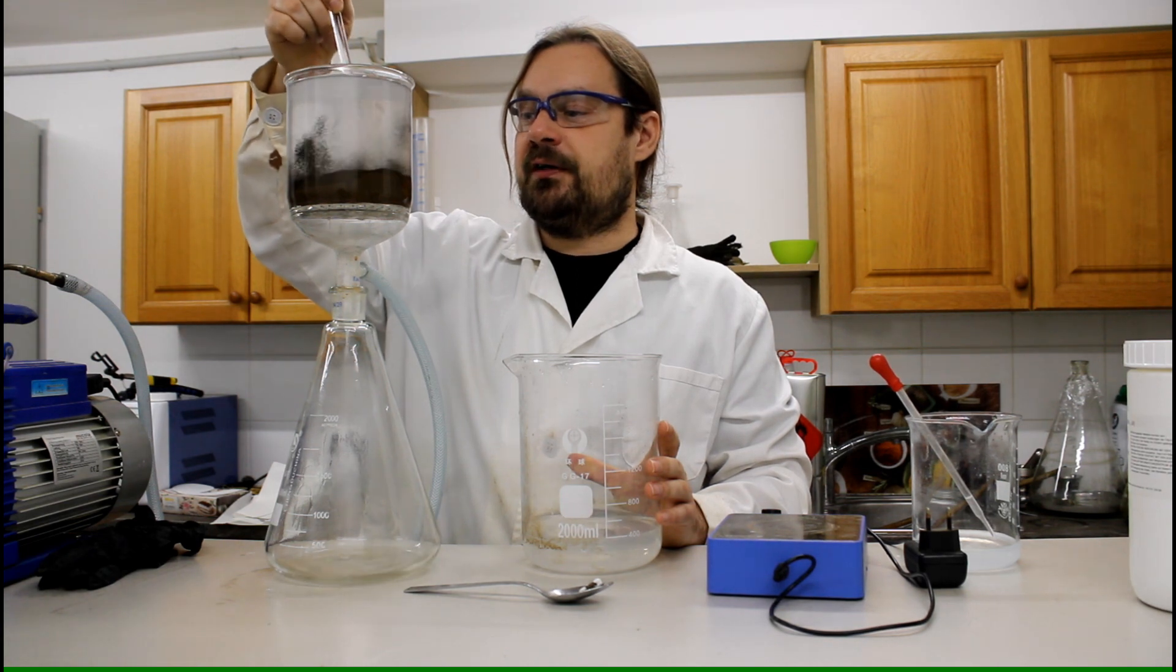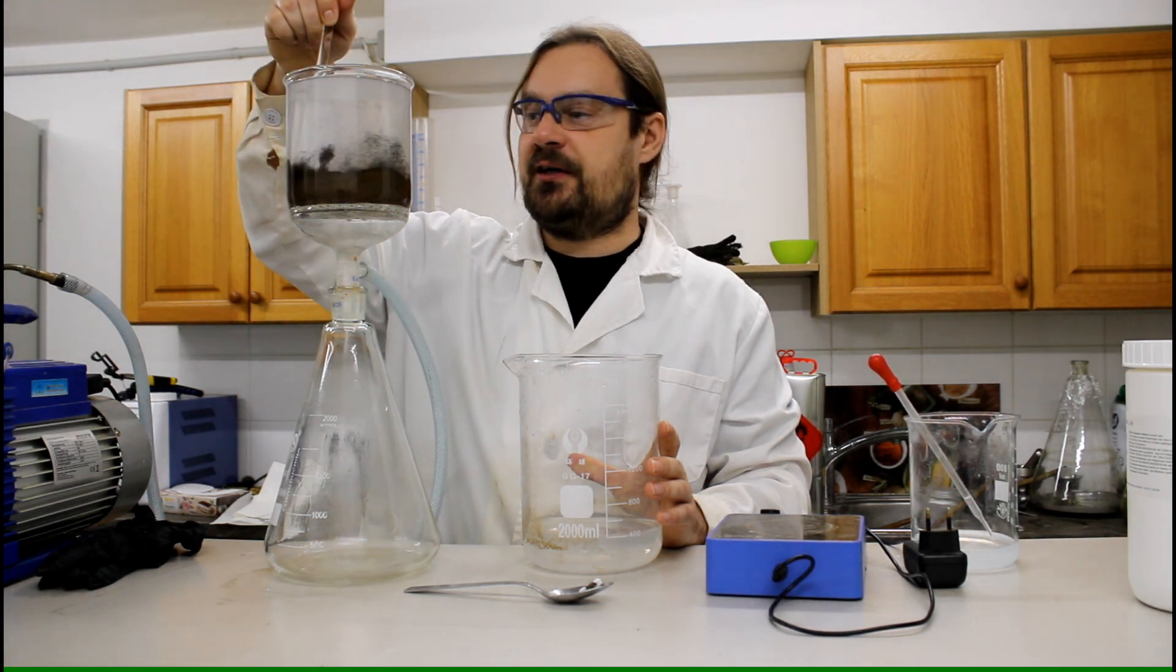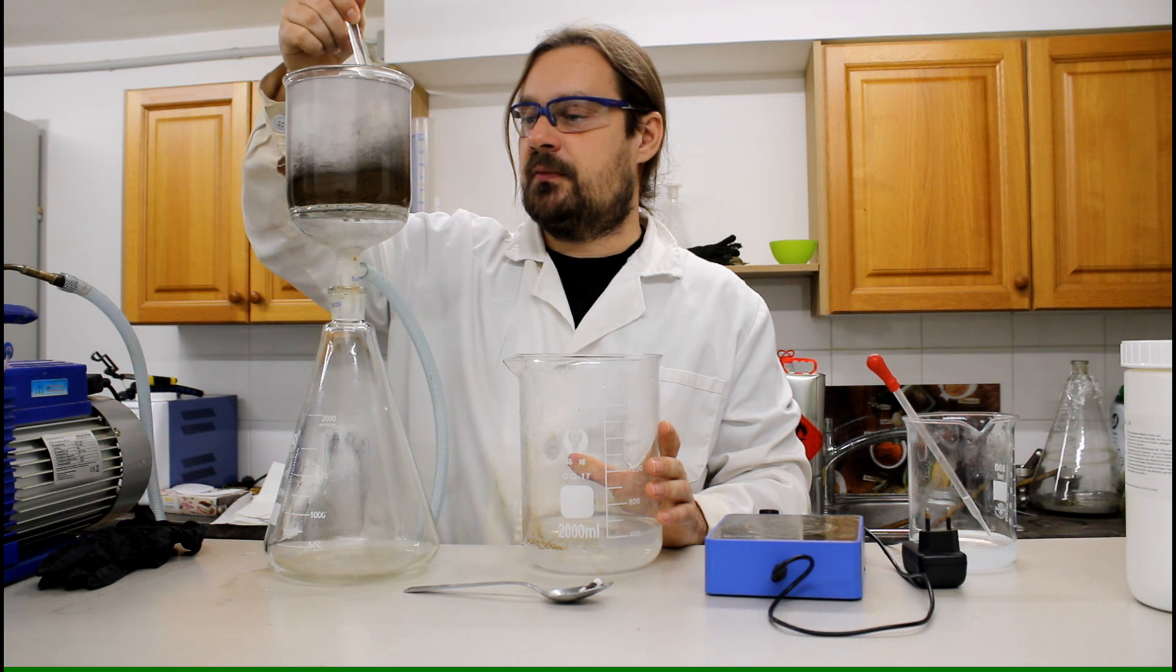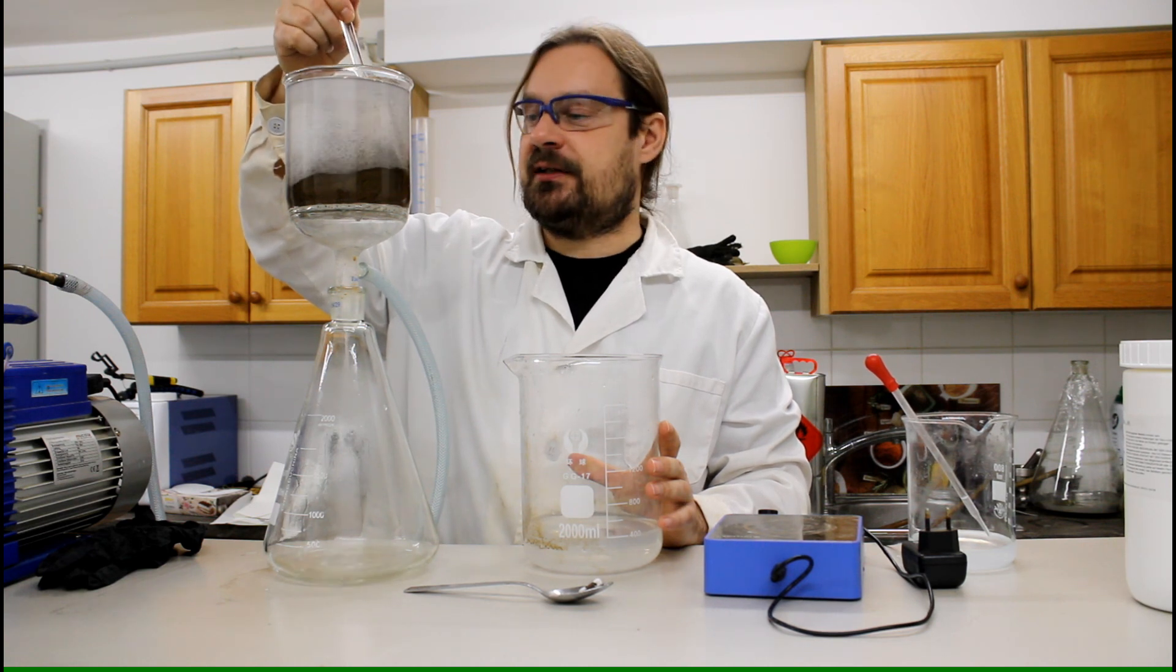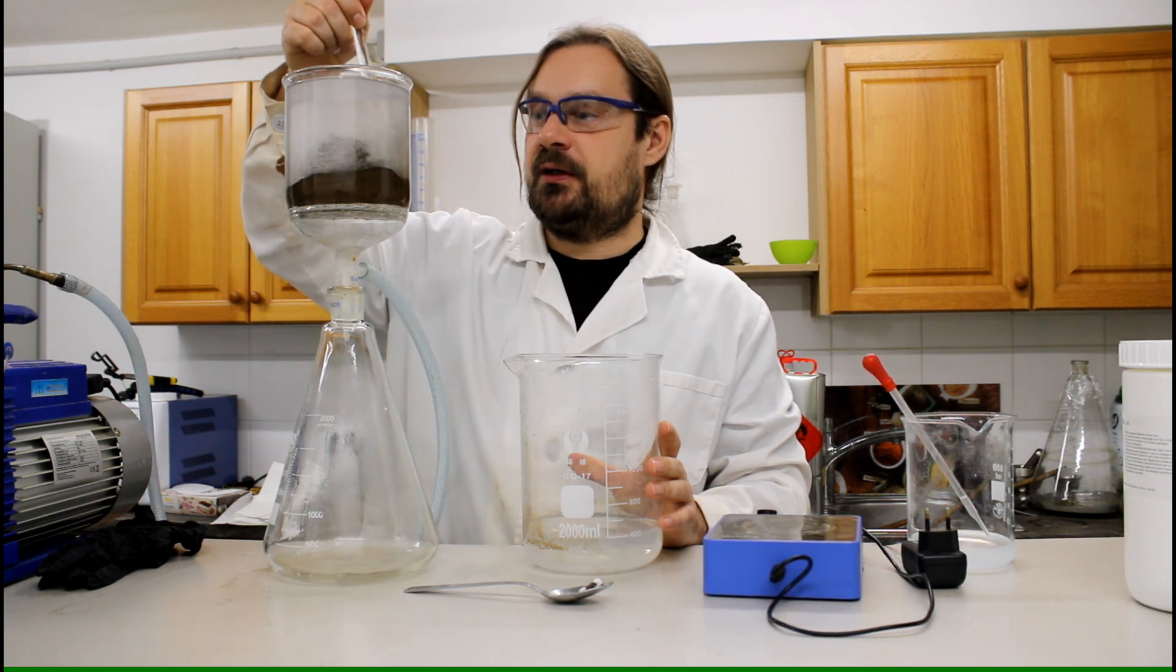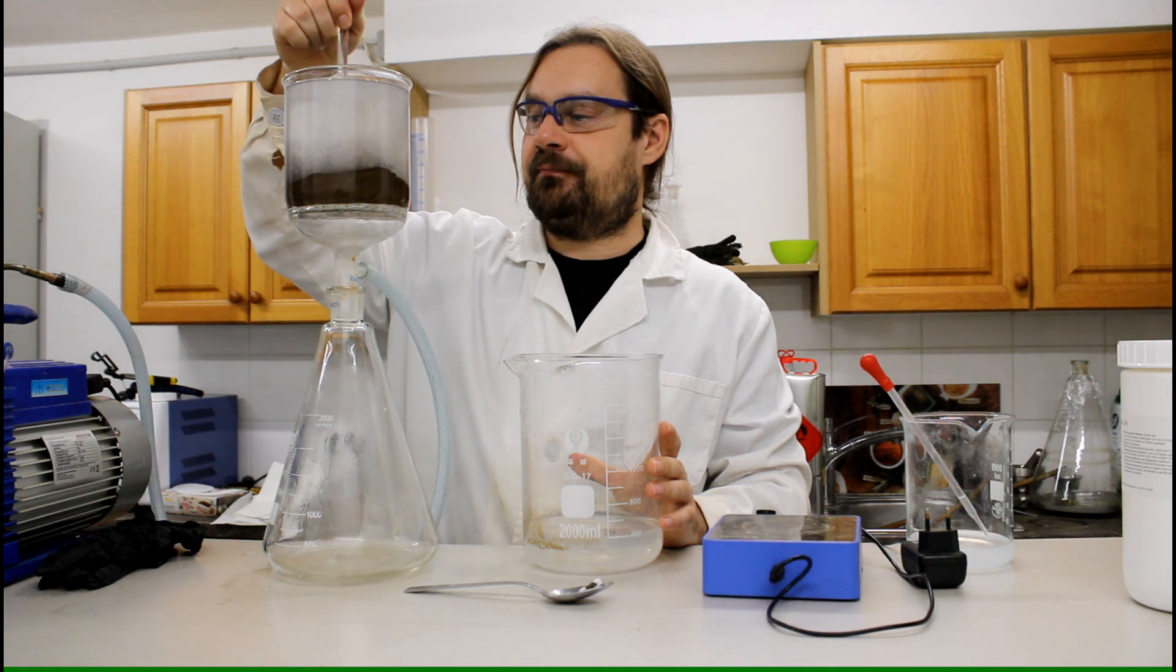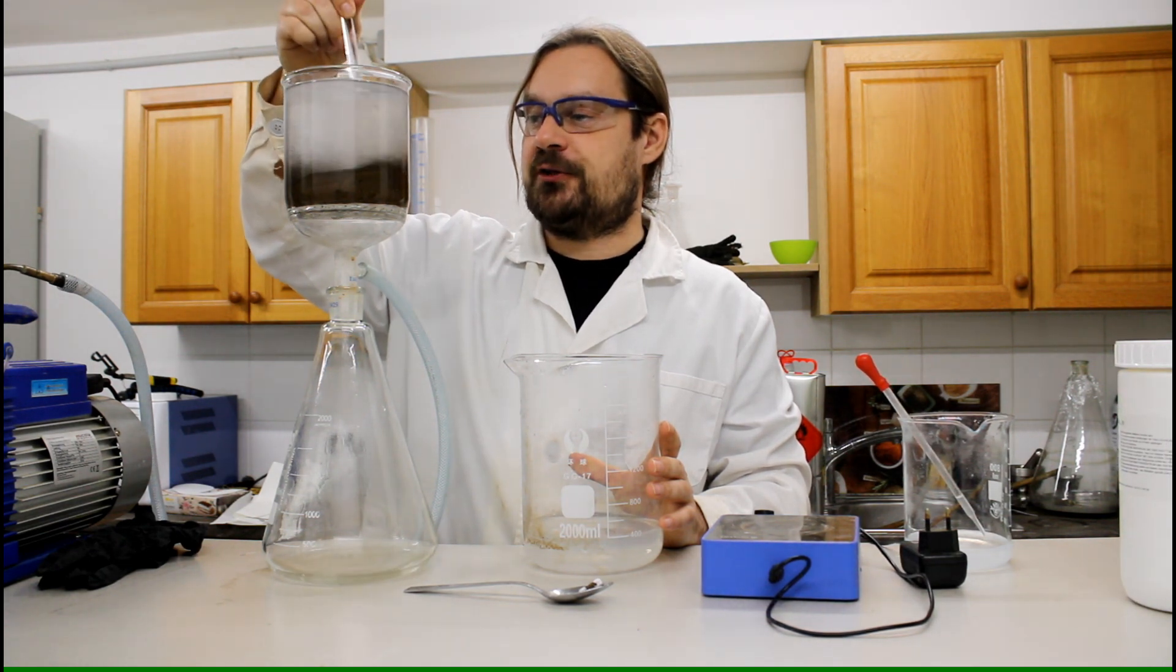So I added water in order to get the sodium hydroxide out. So let's wash it two or three times and then I'm sure that all the lye is washed out.